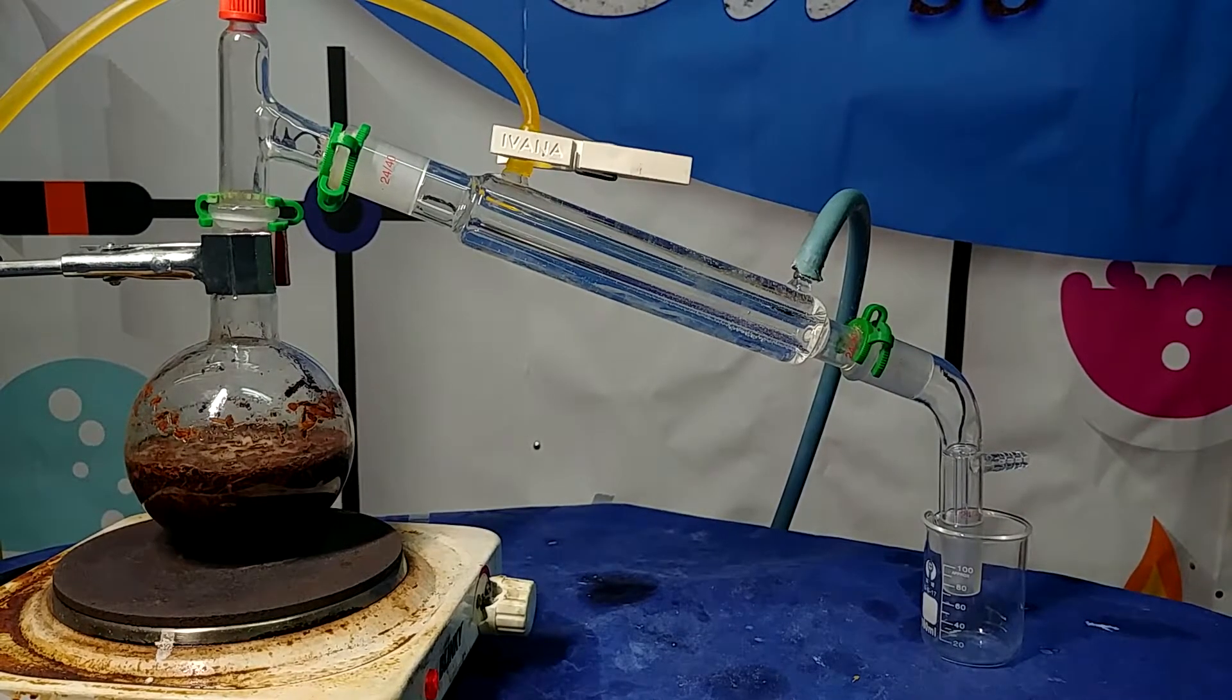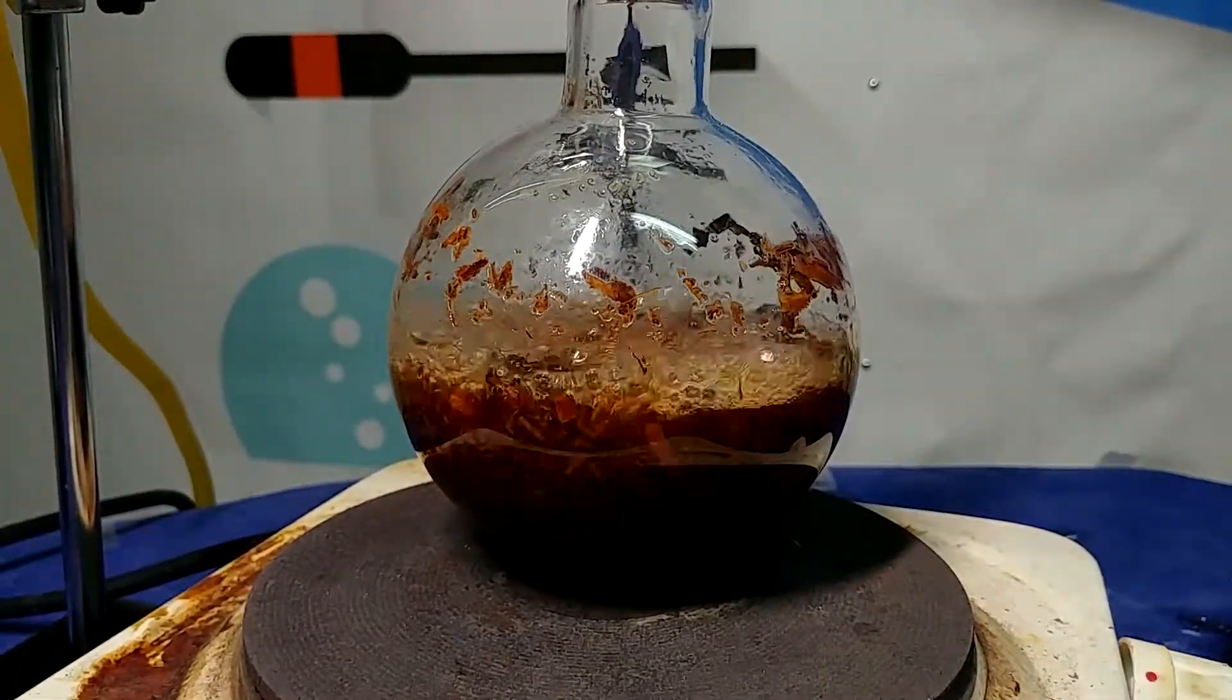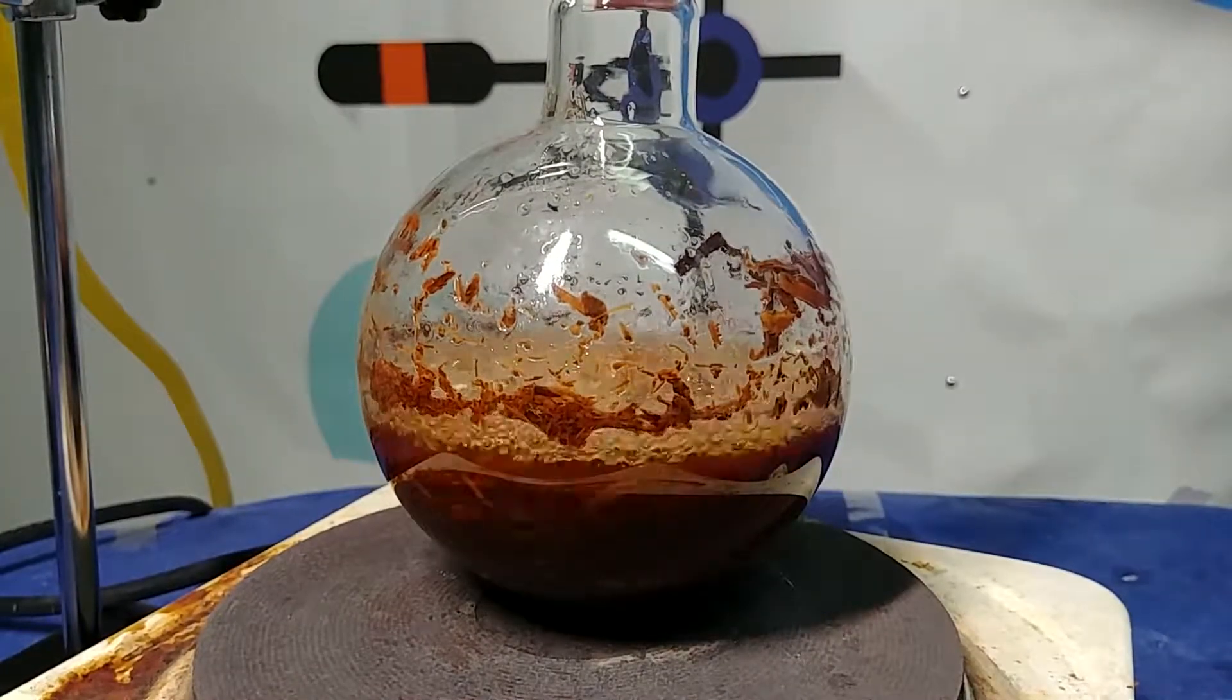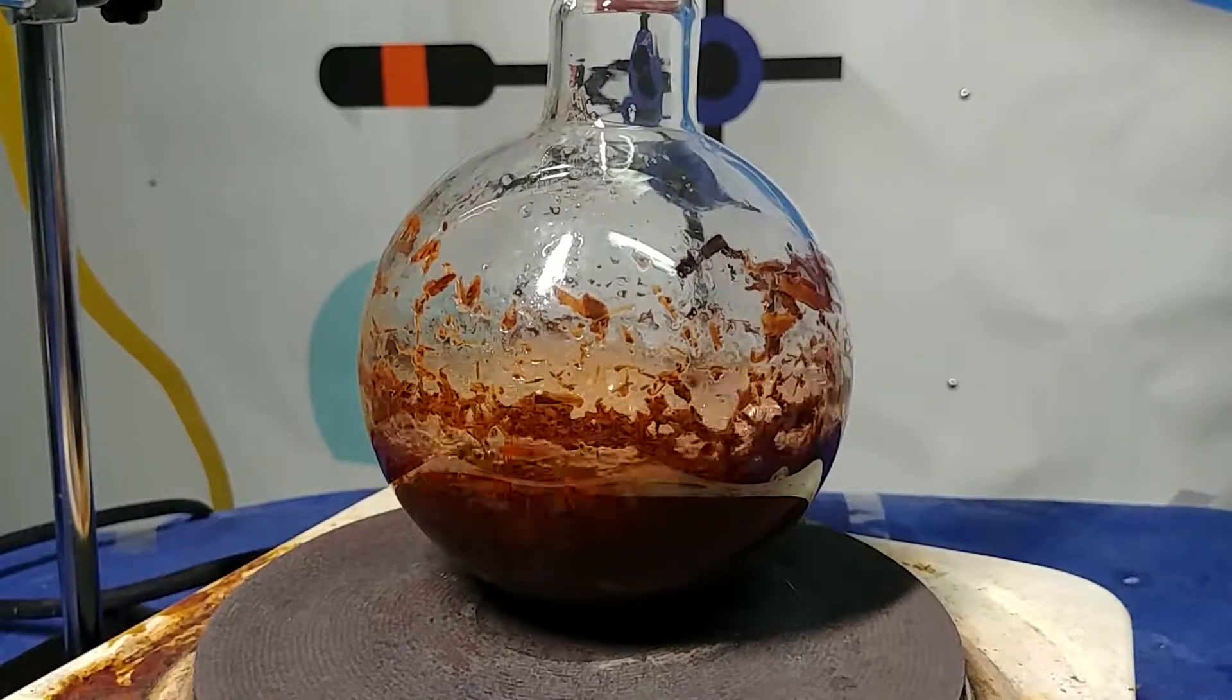In this way we are going to extract the remaining cinnamon and we are going to distill it until we obtain another 100 ml of distillate. Then we are going to add two solutions and proceed.